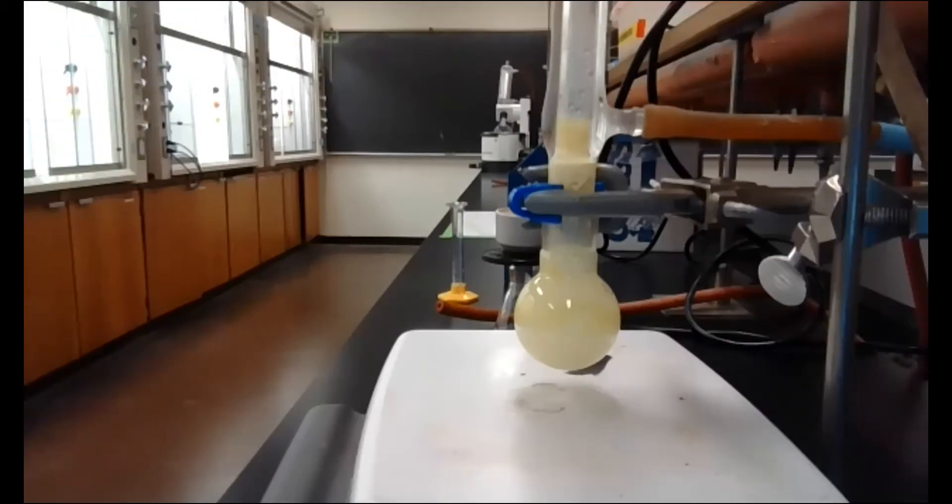All right, so the reaction has been stirring for an hour now. It is kind of a nice yellow solid that's suspended in the liquid. We're going to go ahead and let this cool down, and then once it's cooled down to room temperature, I'm going to vacuum filter it and wash with some cold water, so we'll come back to when I'm at that step.